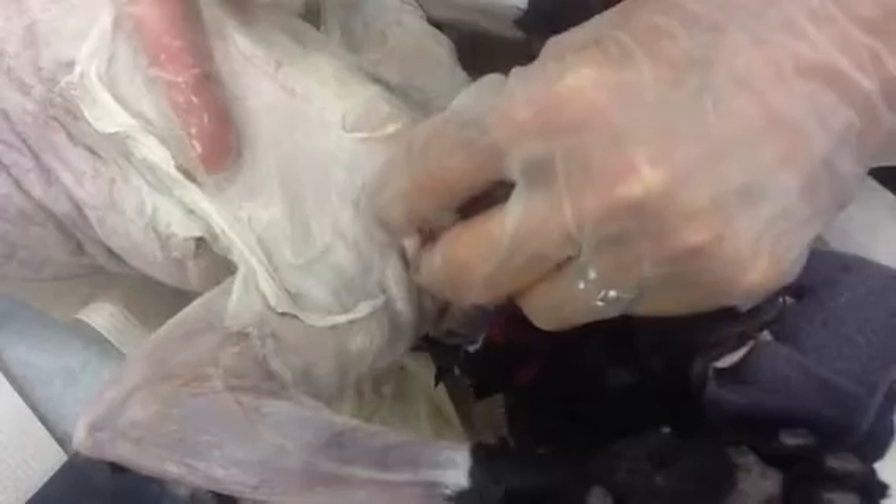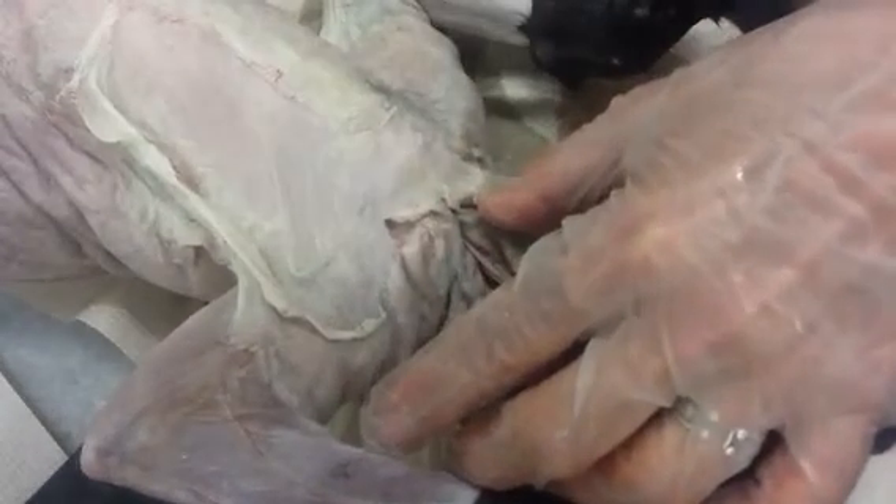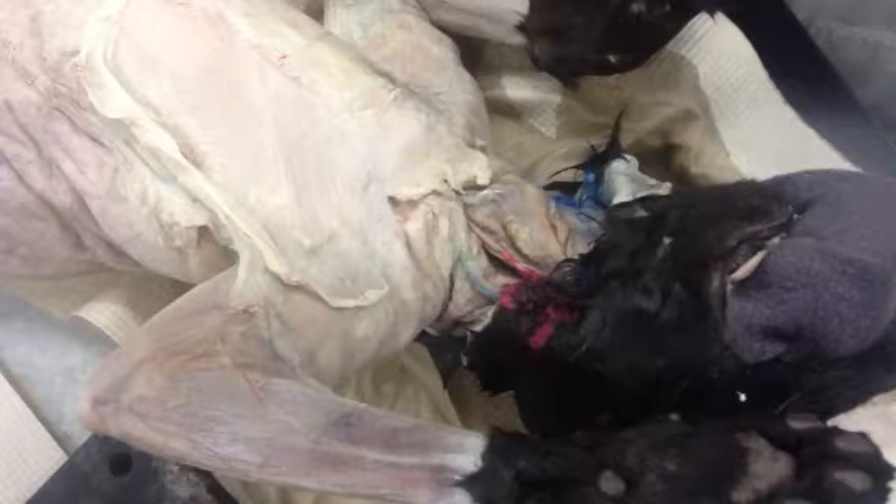What we want to do is look in your lab manual. Can you tell me what muscles you think these might be? You have your lab manual open to the page with those on there. Look at the picture — which part looks like this sort of triangular shape right here, and then next to it, similar direction but slightly different angle? The pectoralis major and the pectoralis minor. Excellent. So this is the pectoralis major right here.